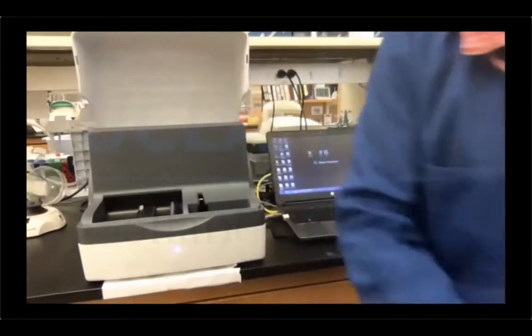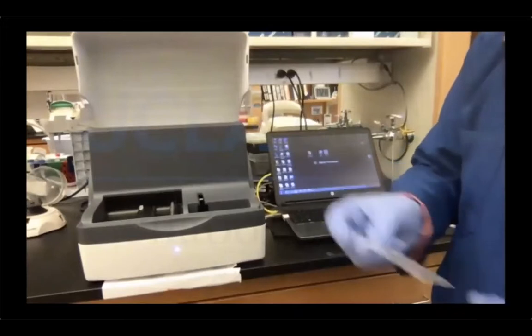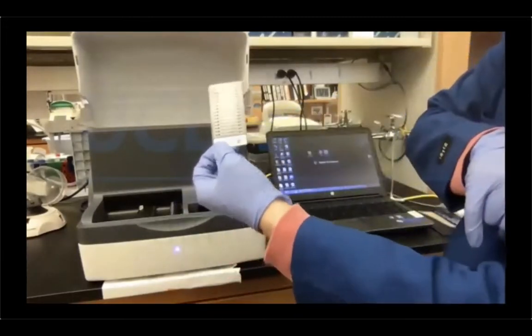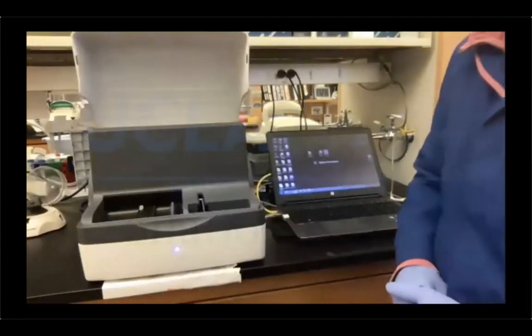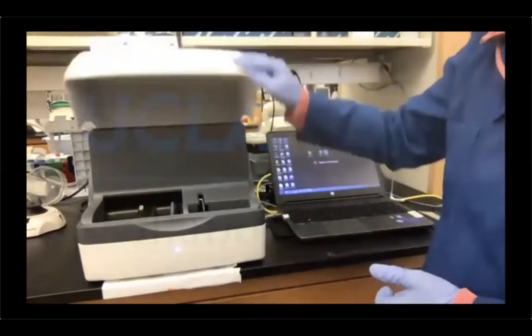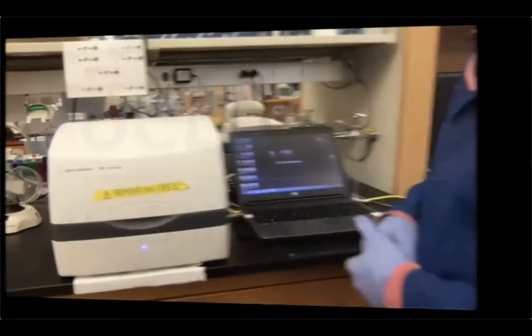There you go. And I'm gonna put the tape in, okay? Again, orientation: the QR barcode goes on the bottom facing the laptop, okay? So I'm just gonna place it here and I'm ready to get started. Okay, so I'm just gonna close this one and we're gonna transfer onto the TapeStation laptop.